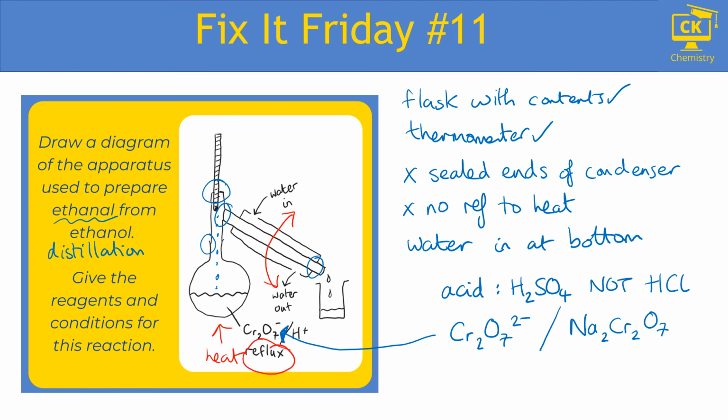They've drawn the correct diagram for distillation, but because you just get into a habit, we've got the word reflux, which is a completely different setup, with the condenser being vertical above the flask. And if I refluxed that reaction, I wouldn't make ethanal, I would make ethanoic acid. So make sure you don't go into autopilot and start including things that you write loads of times for reaction conditions. Just because you write them lots doesn't mean you write them all the time.